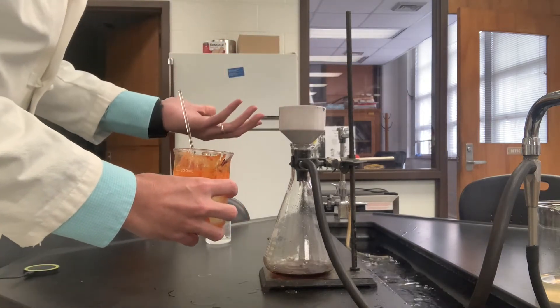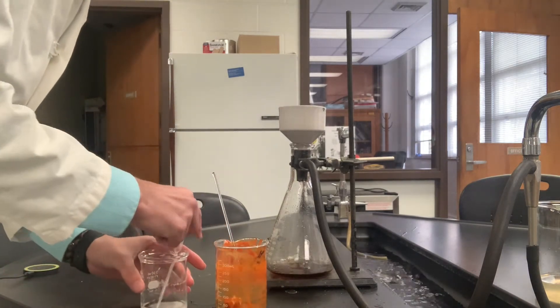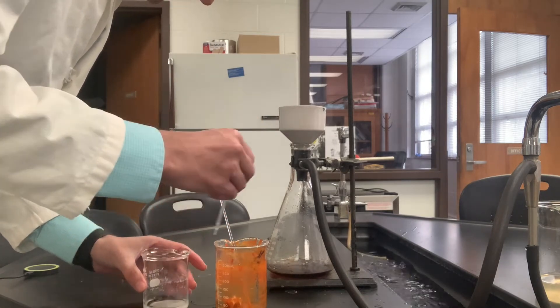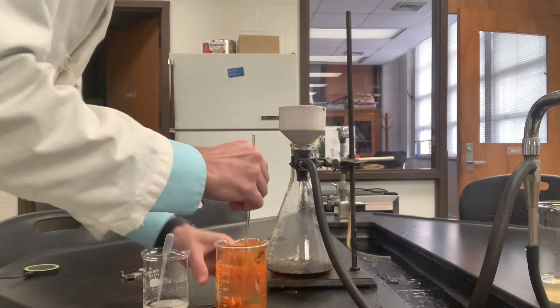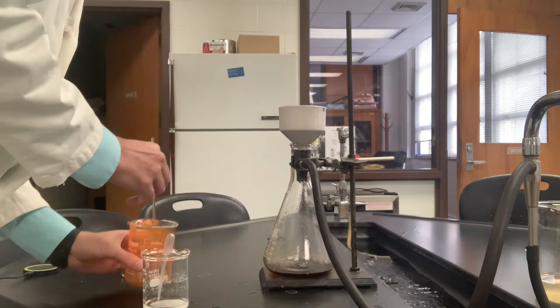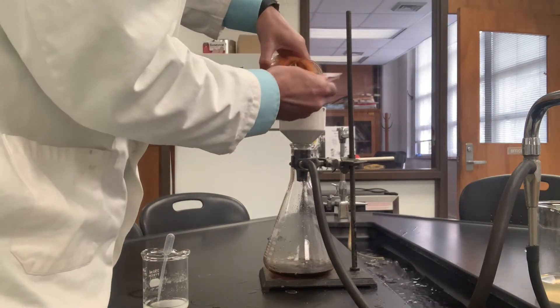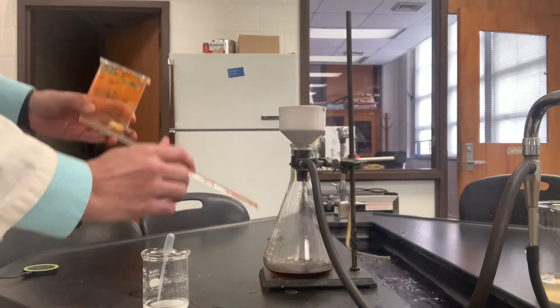This funnel is filled up about halfway — it's a massive amount of material to make in one lab. Now we want to rinse the sides here with ice-cold saturated sodium chloride. It doesn't work too well, but we do our best. It's so highly colored you have the impression that there's tons of material left behind, but really it's not that much at all. The magnet is quite nice — it just holds the magnetic stir bar on the bottom of the beaker.